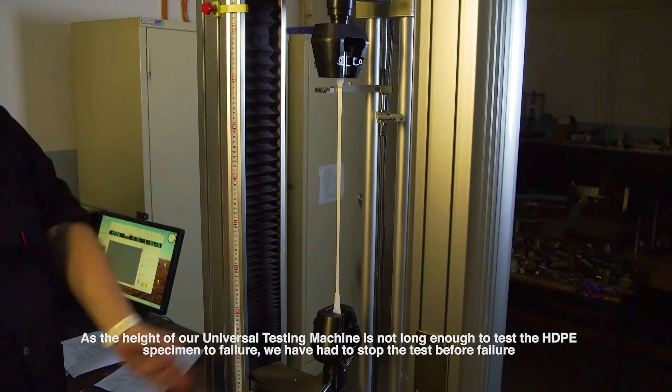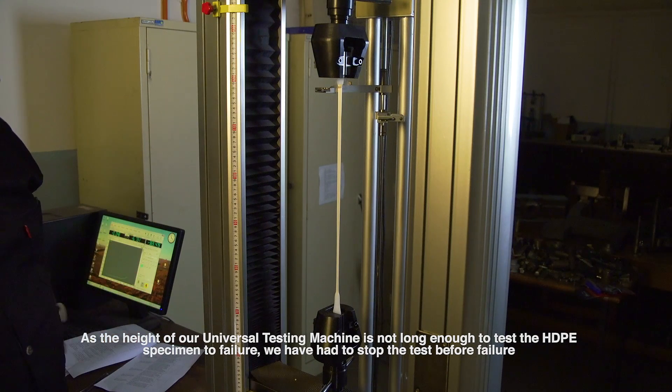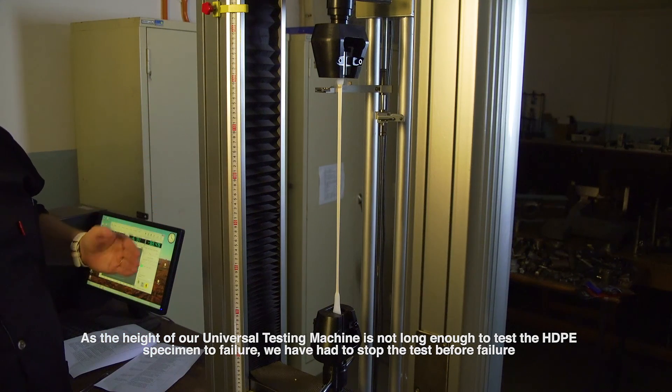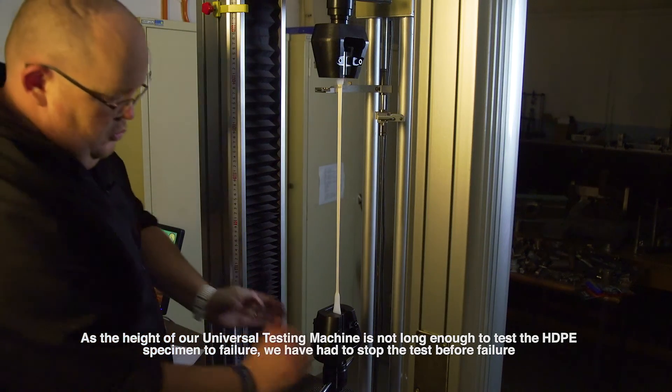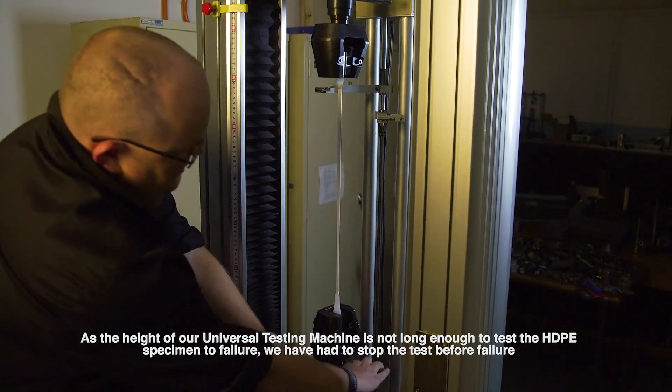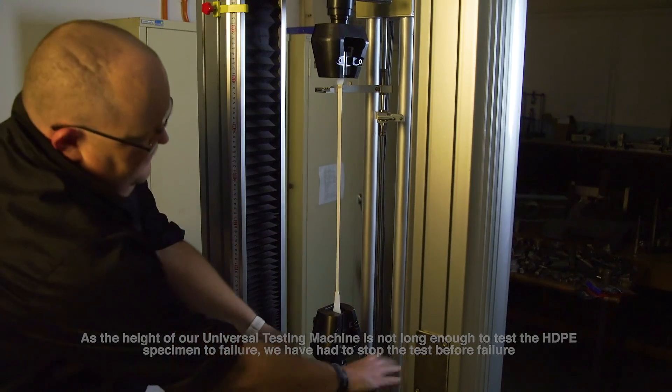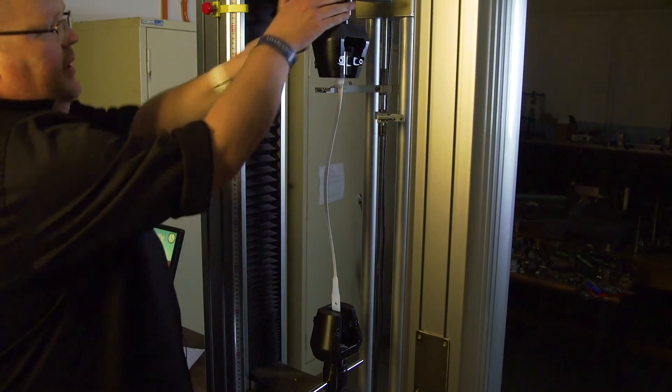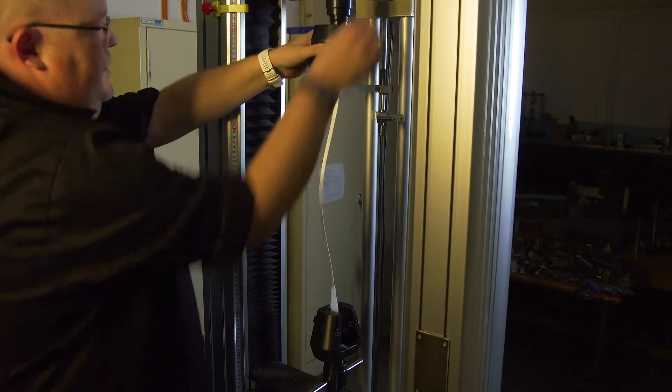In reality, because of the nature of HDPE, I don't actually have enough height here in order to test this sample to failure. Now look, when I release this grip, you can see now it should spring back a little bit. You see that? So that little jolt up is the elastic recovery in this specimen.